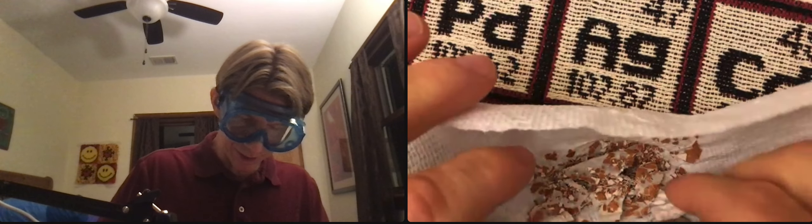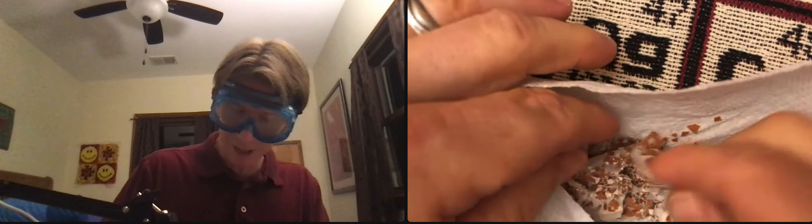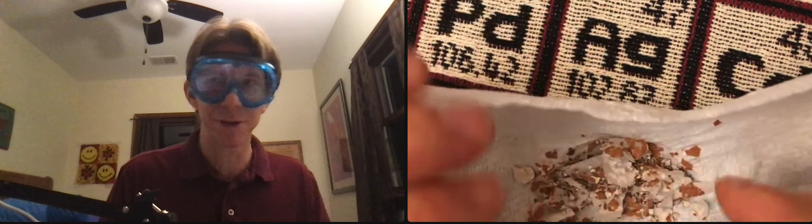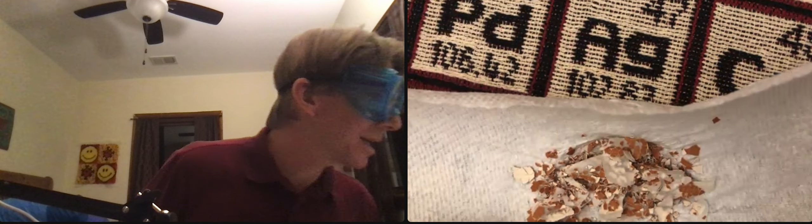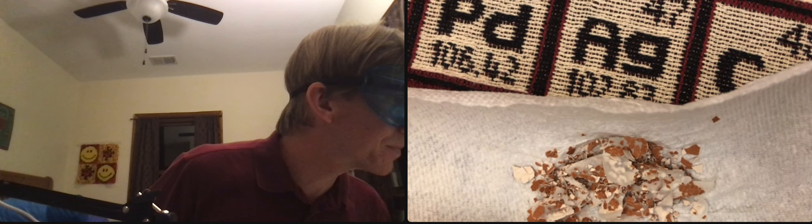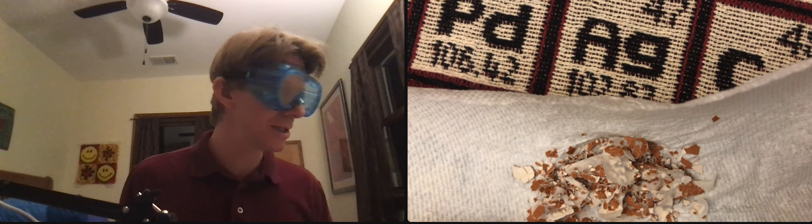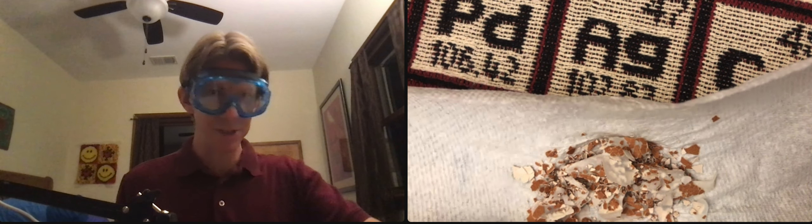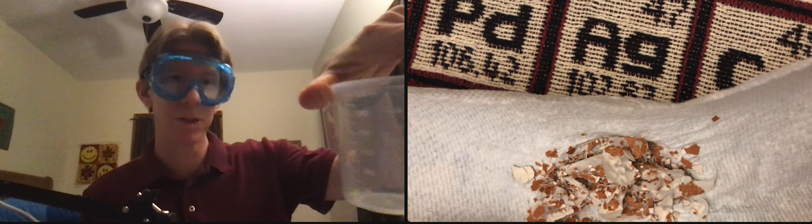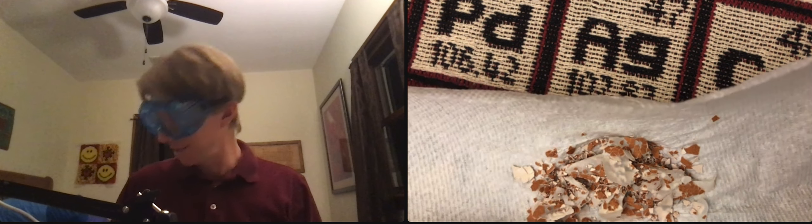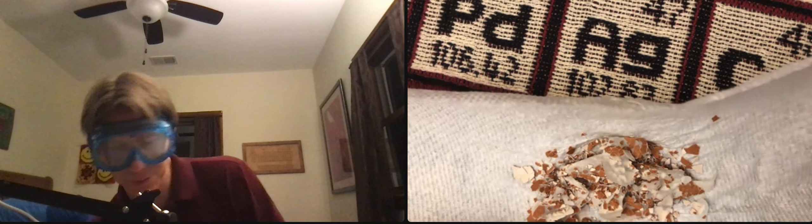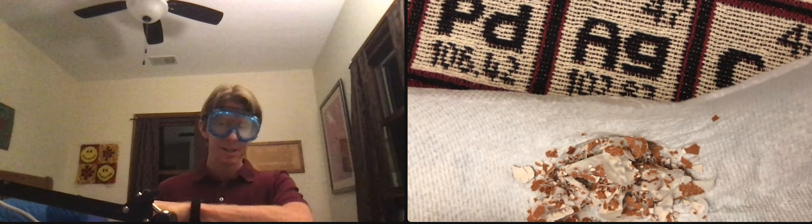I think we're going to call that good. You can see there is some membrane material there, and that's fine - that's part of the 5%. Place approximately 25 milliliters of vinegar into a 250 milliliter beaker. I've got my beaker here - this one's 300 but approximately 250.